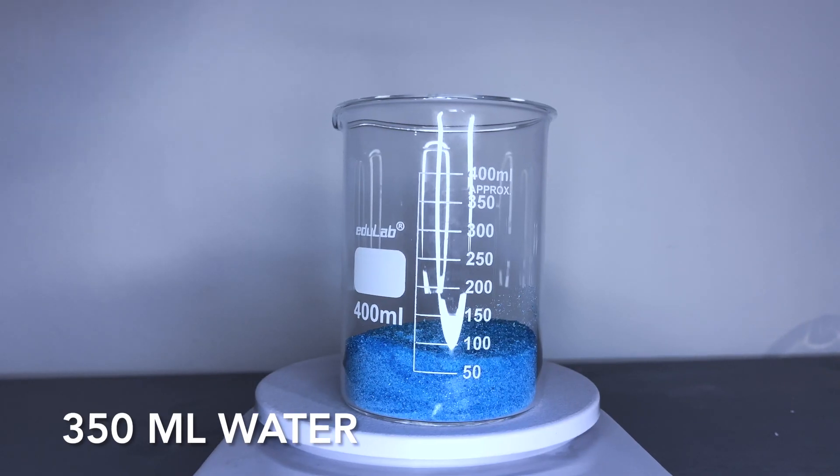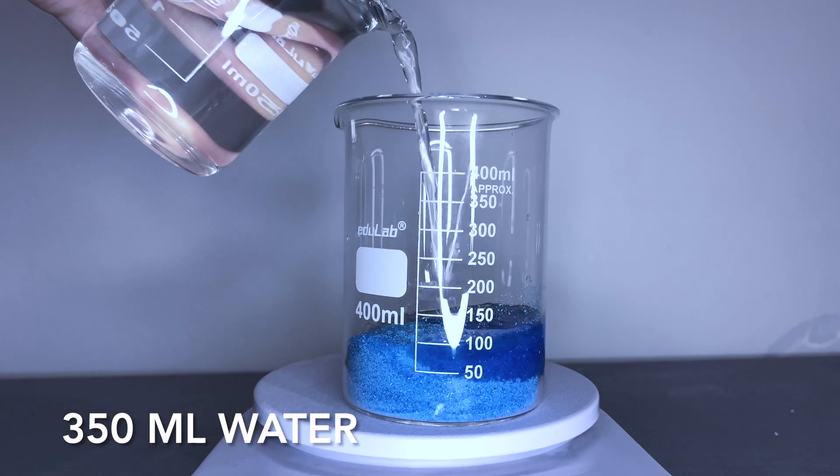Now, I am adding 350 ml water to soak up copper sulfate salt.